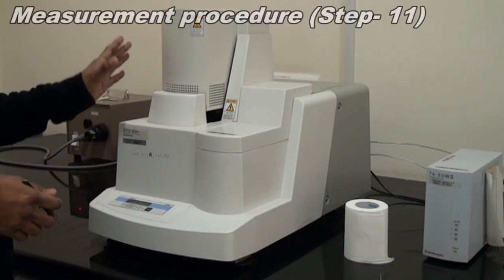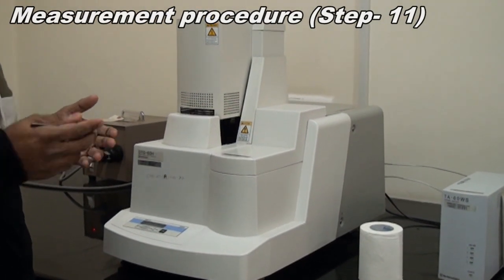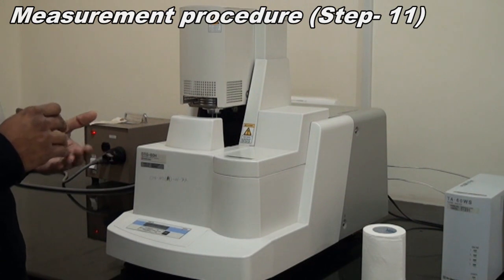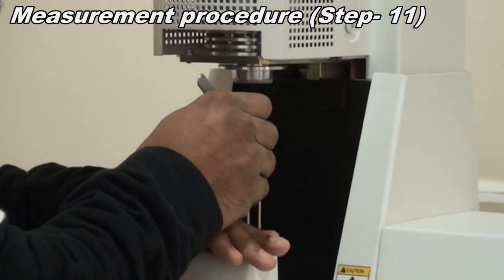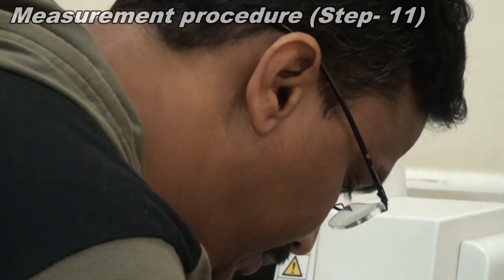Then you take out your sample pan and clean it completely, whatever residue is present. This is me taking out my sample pan. I am just cleaning it.